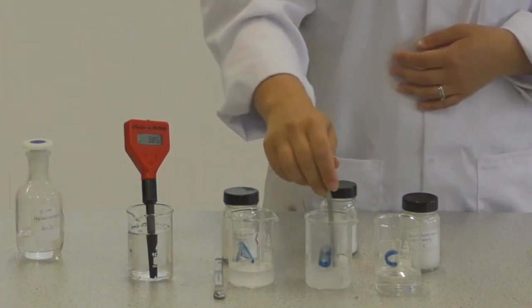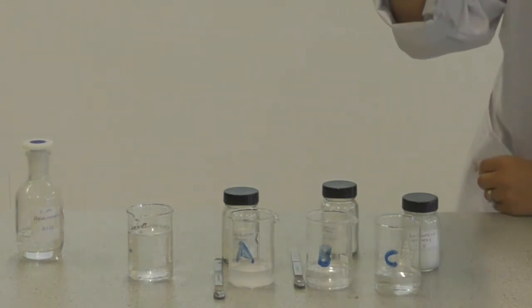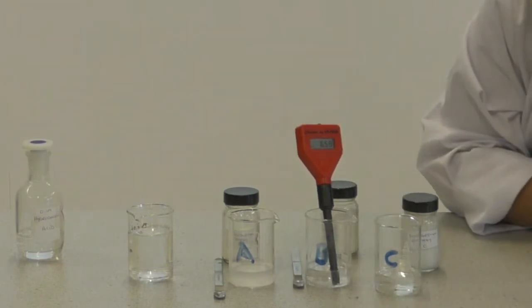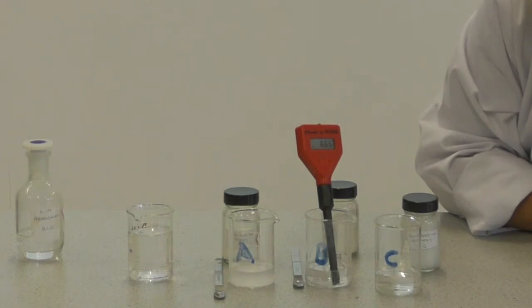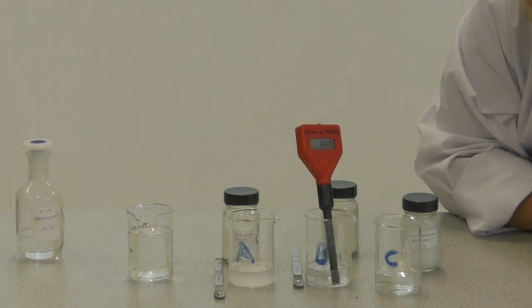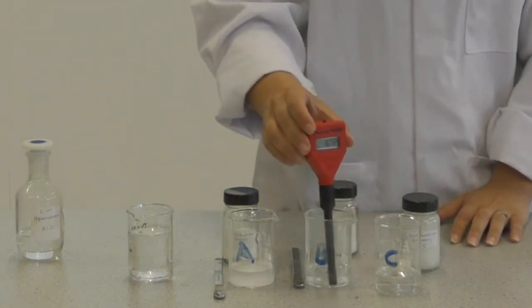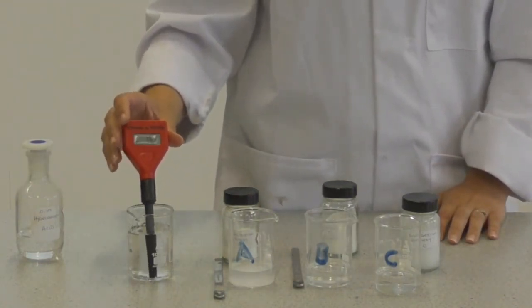I wait for the fizzing to stop before inserting the pH probe. Once the reaction is over, the probe is inserted and the reading instantly jumps much higher — up to pH 6.65, then settling at 6.69. It's almost neutral — it has almost reached pH 7, showing a very effective neutralization reaction. I record the result.